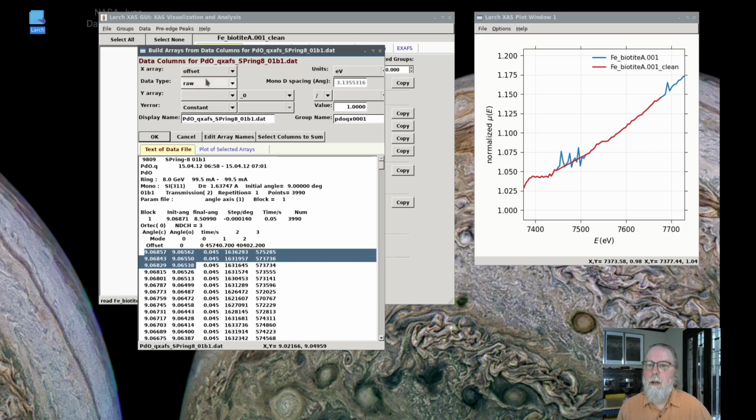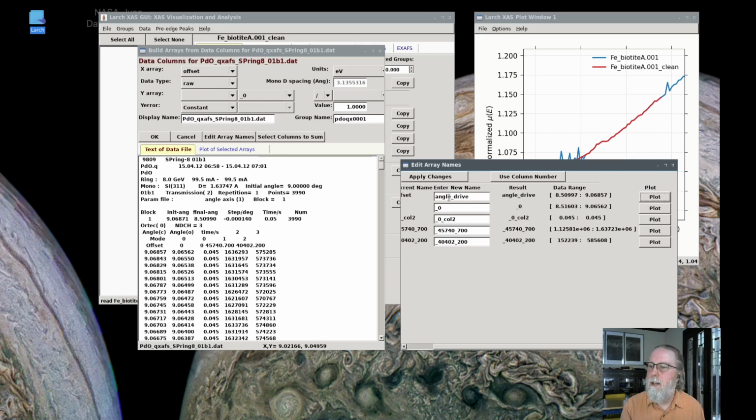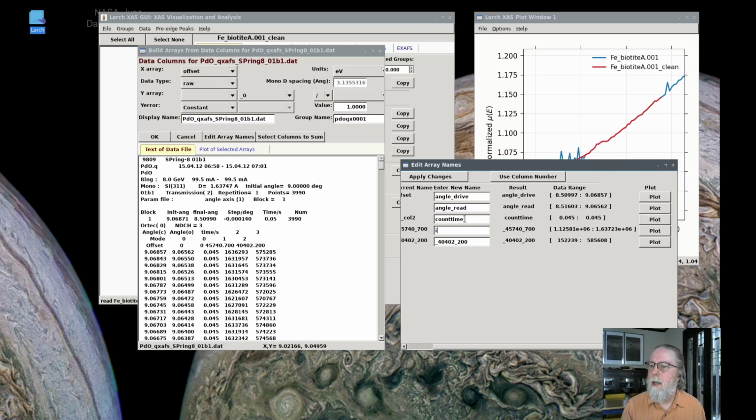In fact, you can also see that the array names are a little hard to understand. So first I'm going to edit the array names, which brings up this dialog box. And you can see here that I'm pretty sure the first column is angle drive, so the requested energy, and the second one is angle read. And then it looks like the next one is a constant of 0.045, and I'm going to guess that's the count time. And then the next channel is I0 and the next one I1. So I'm just going to say apply those changes.